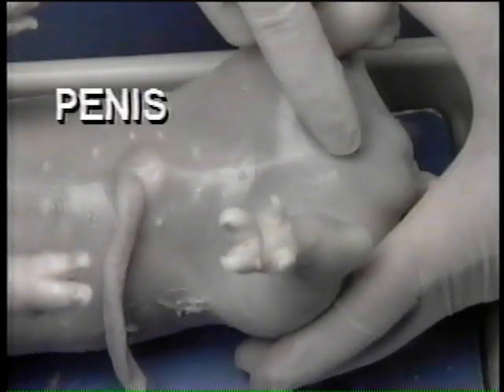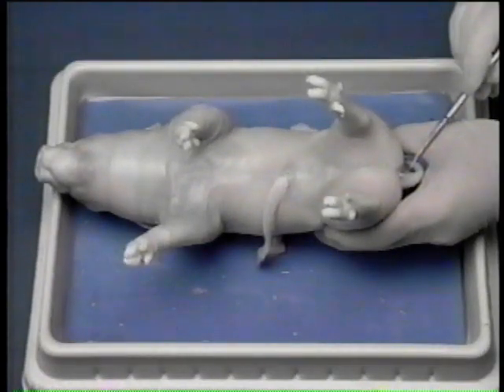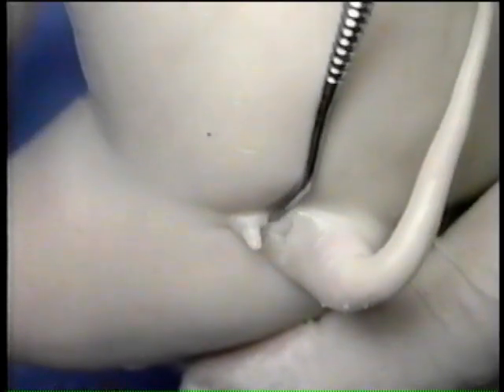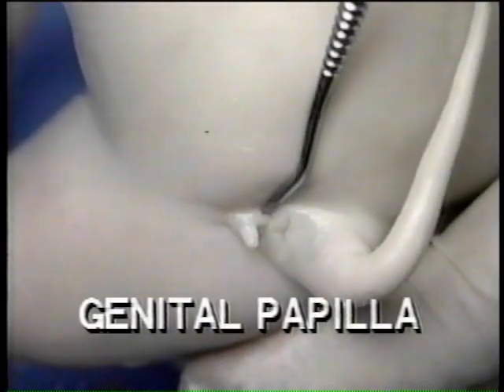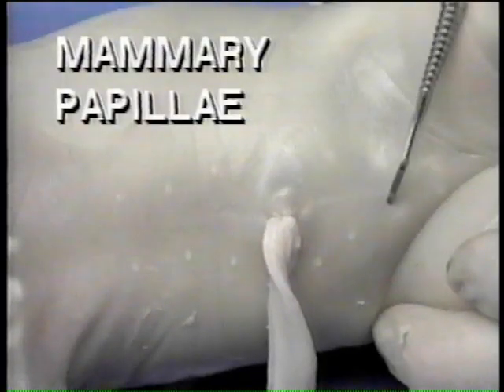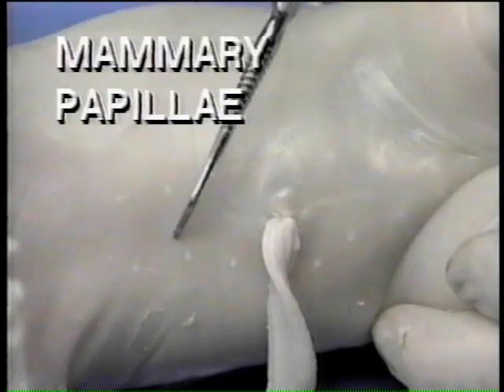This is the penis. In the female, the urogenital opening is located immediately ventral to the anal opening. Projecting from the urogenital aperture is a small, fleshy genital papilla. Both the male and the female have 2 rows of mammary papillae, or teats, on the abdomen, with 5 to 7 nipples in each row.